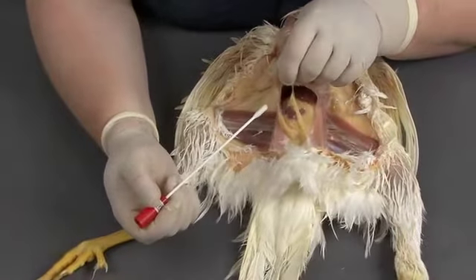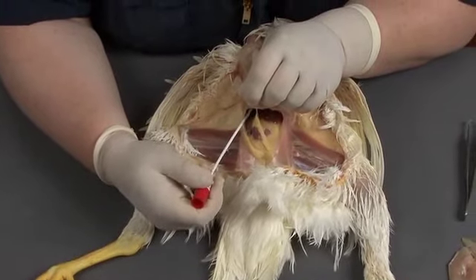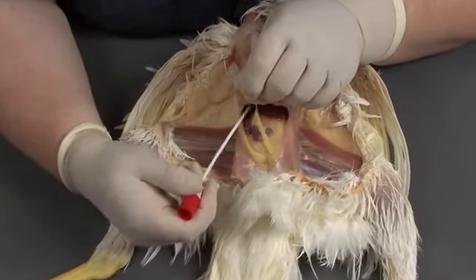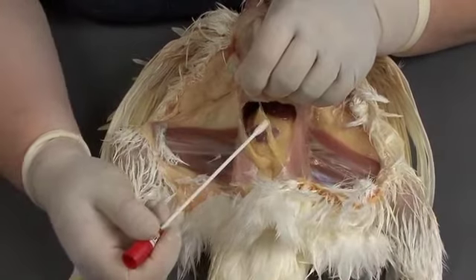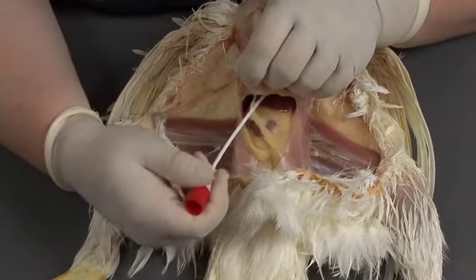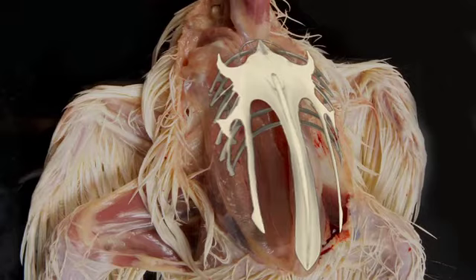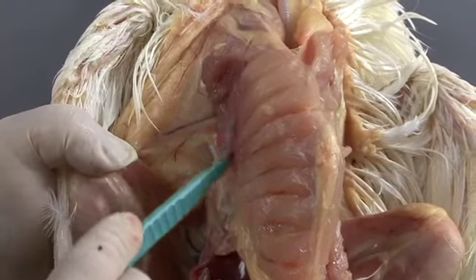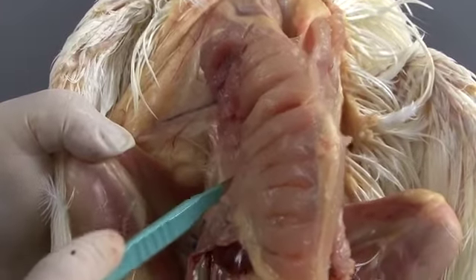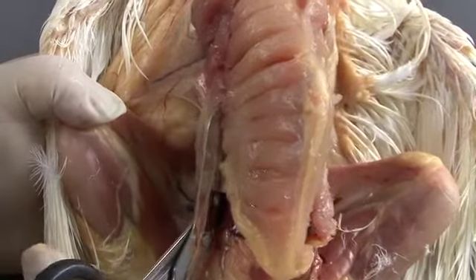Before continuing the necropsy, determine if any bacterial cultures or other samples need to be collected from the coelomic cavity at this time. Keep in mind that the tissues will be least contaminated at this stage in the exam. To expose the cranial coelomic cavity, you will remove the sternal ribs and keel. If the pectoral muscles have been left in place, you can make a shallow incision along the surface of the muscle to mark a path for the shears.